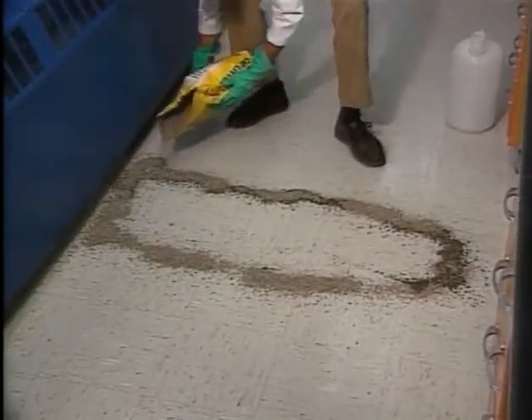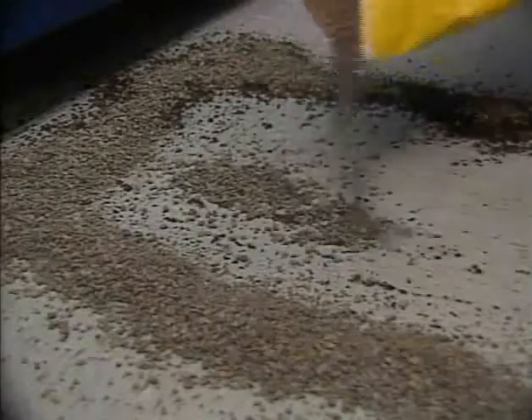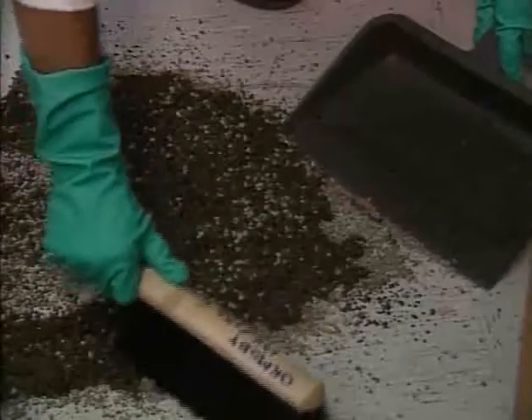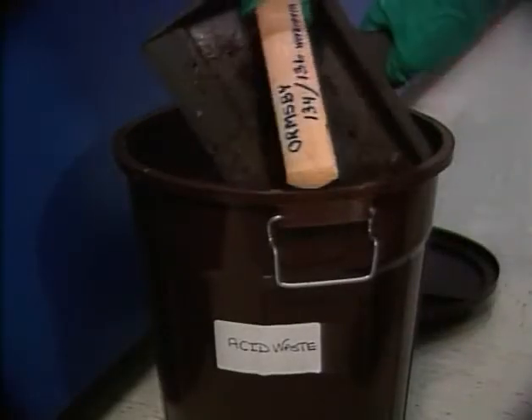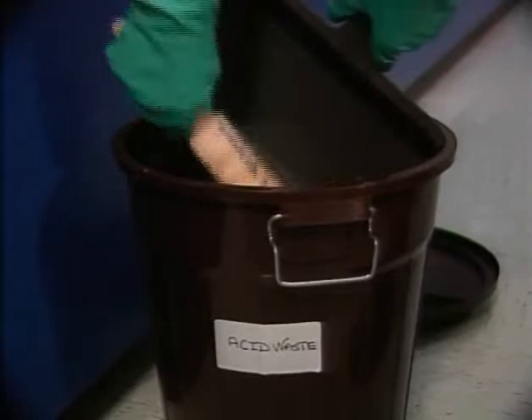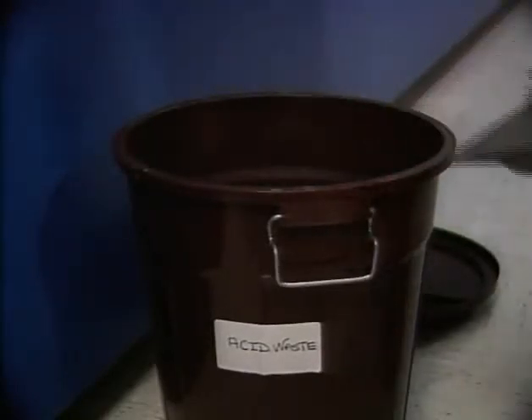To keep a large spill from spreading, it's barricaded with an absorbent material such as kitty litter. It's either mopped up or covered over completely with the absorbent. The absorbent and chemical can then be swept up with a broom. What's done with the residue depends on the type of chemical it contains — your lab should have a container for each type of waste.